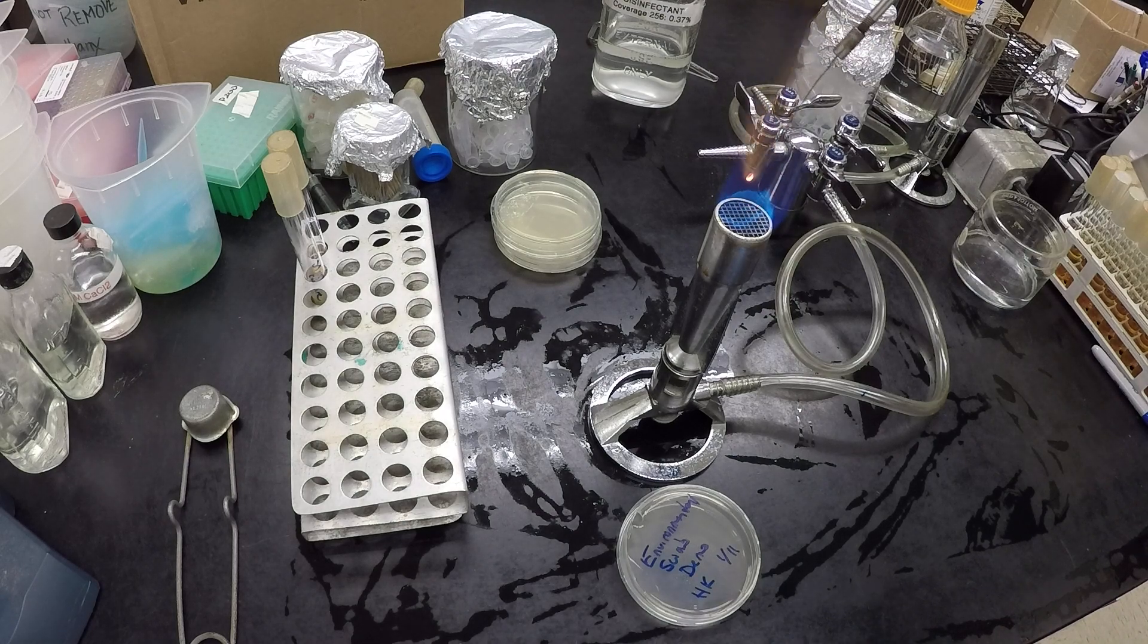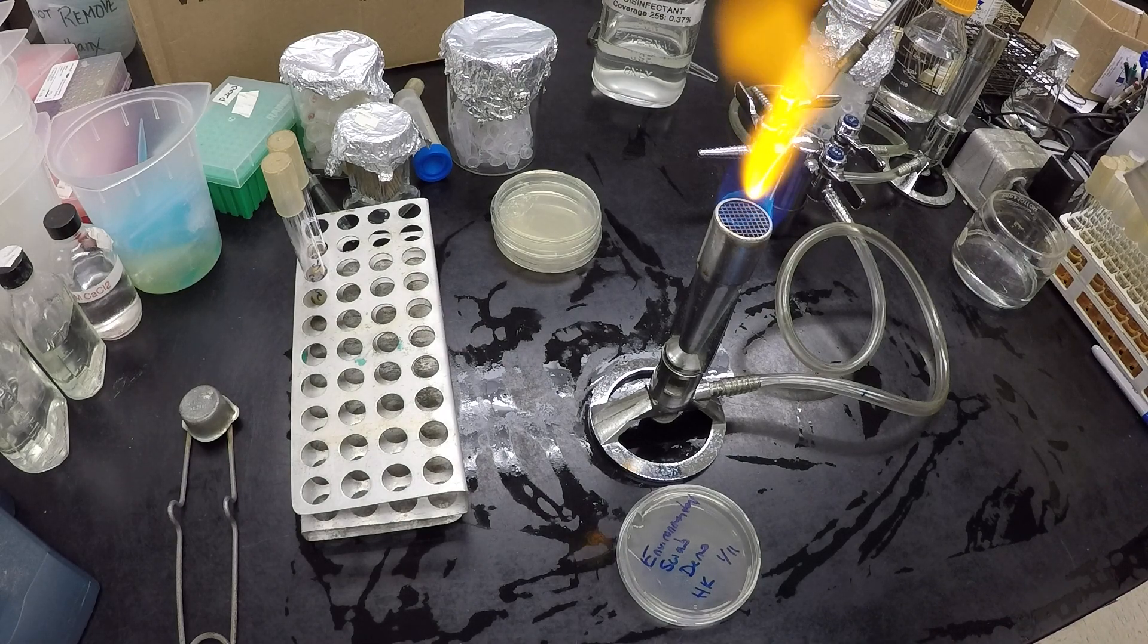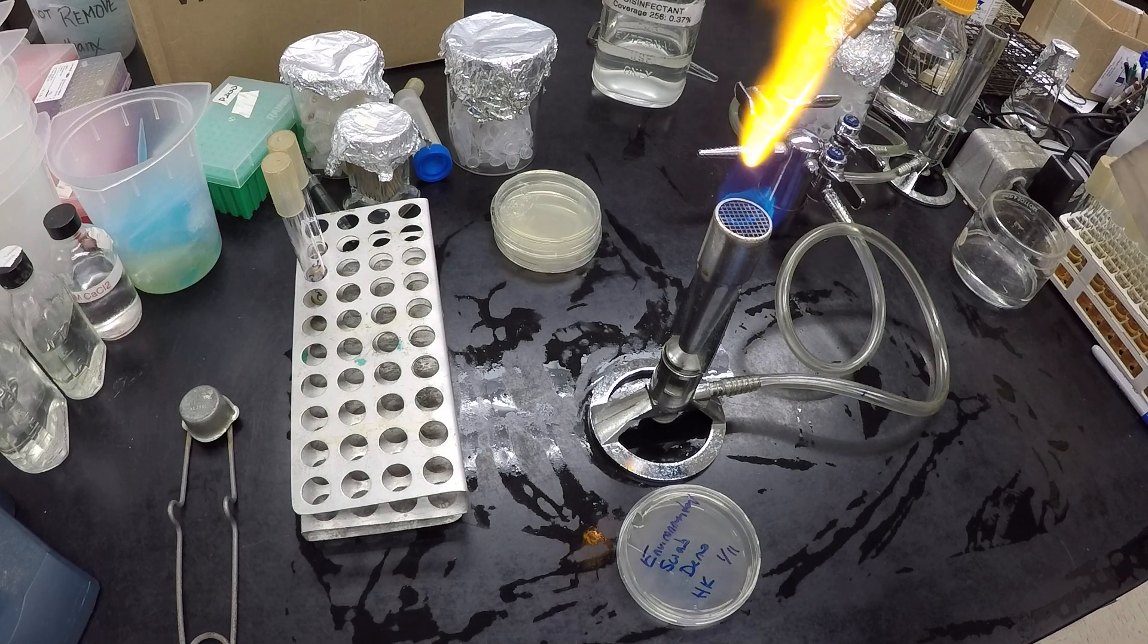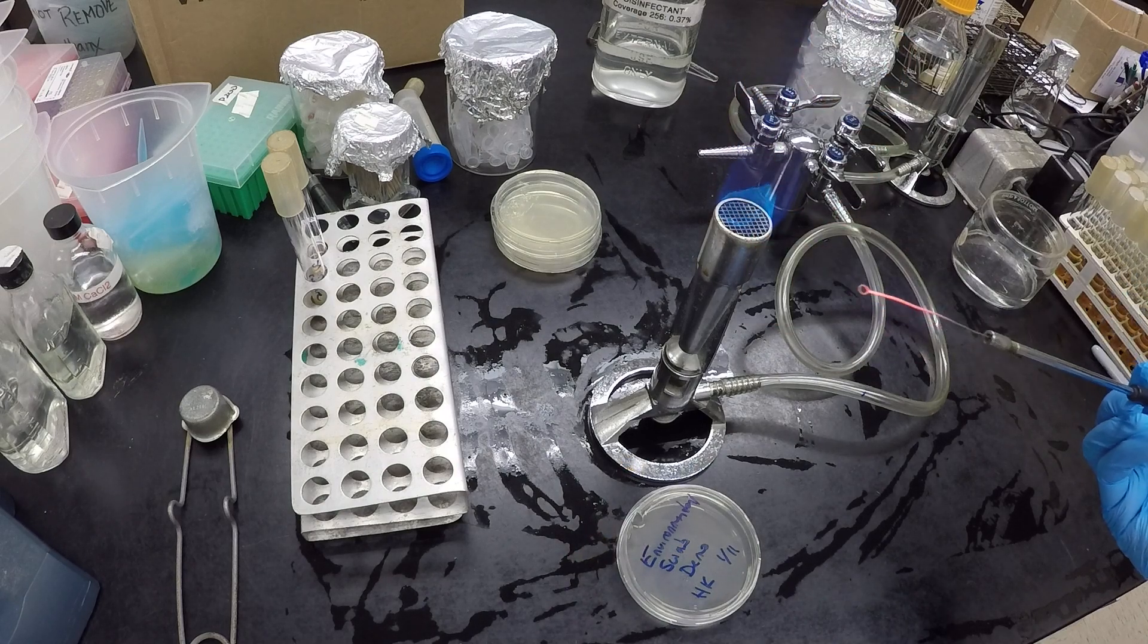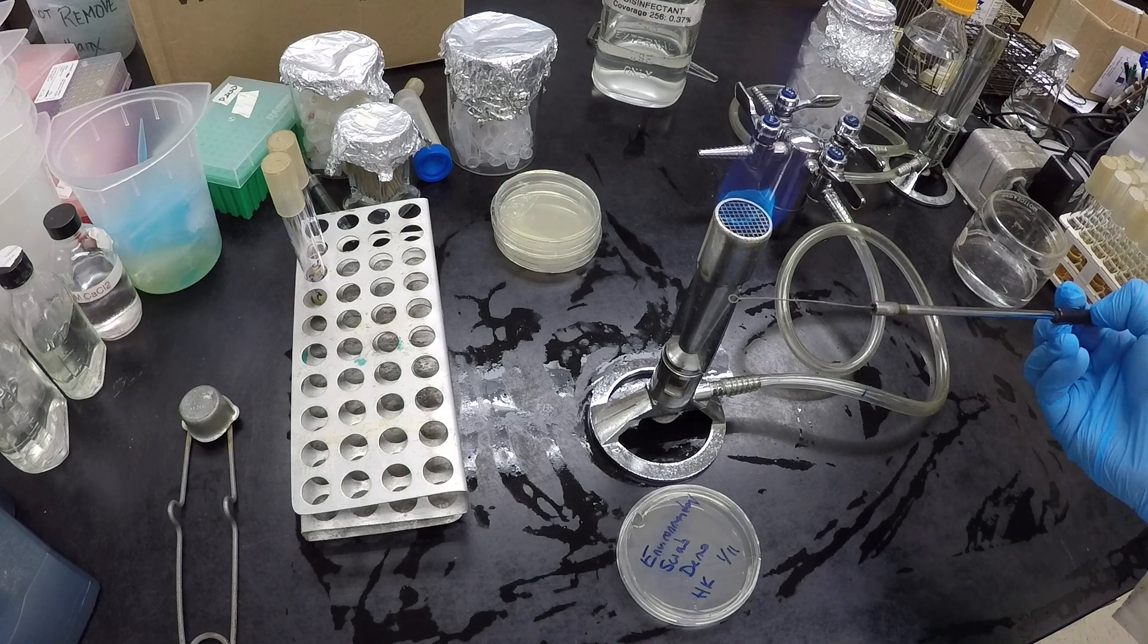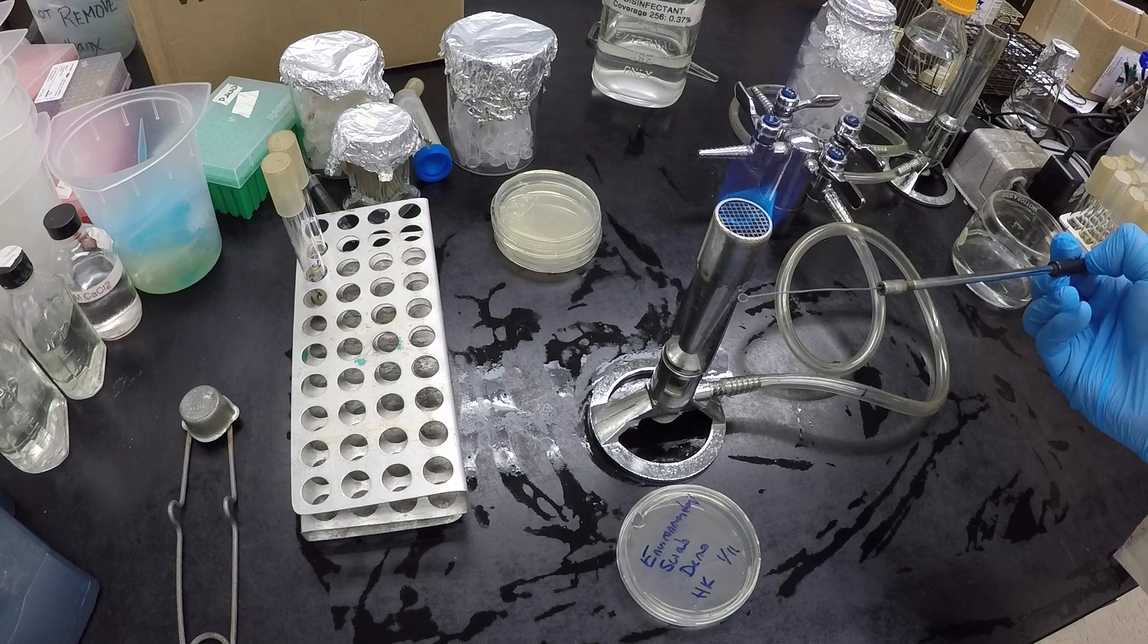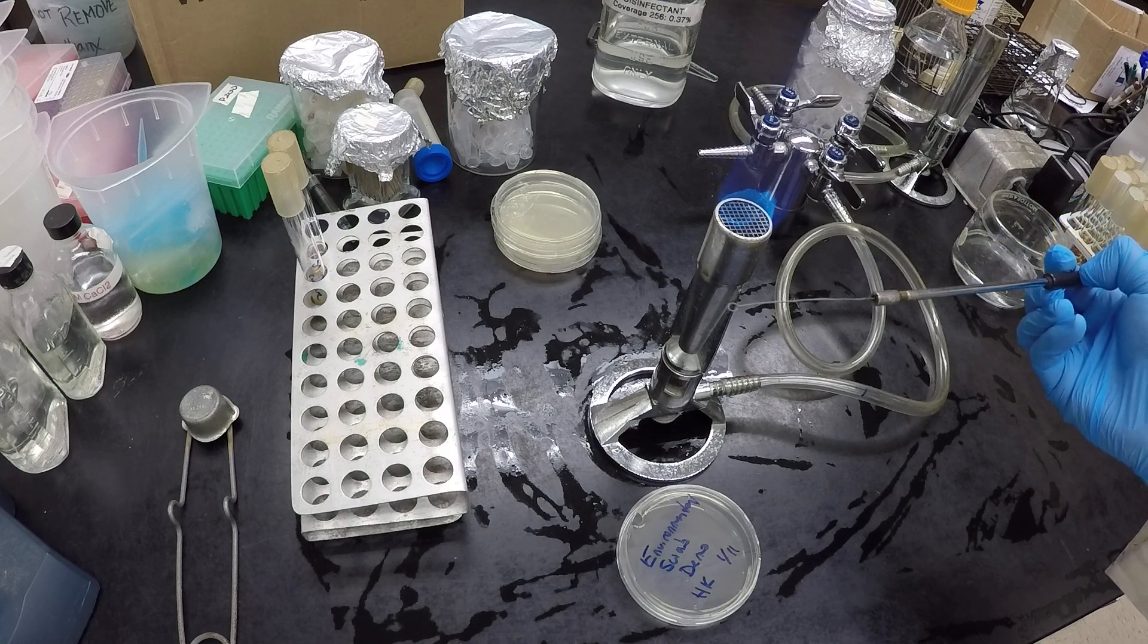Similarly, when I was letting my loop cool. Because remember, this is going to be crazy hot. If I touch this stuff, it's going to sizzle and kill my bacteria. Let it cool by the flame. So this is where I'm going to hold it. Loop is always going to be near my flame, not anywhere else.